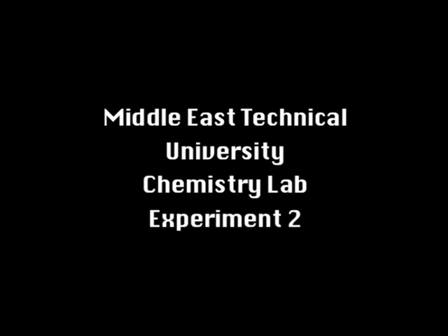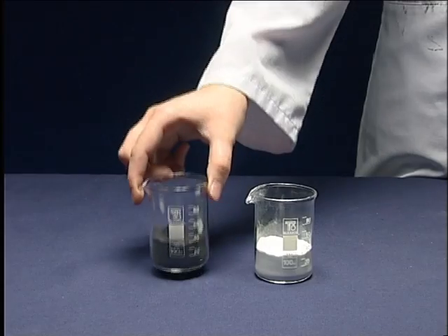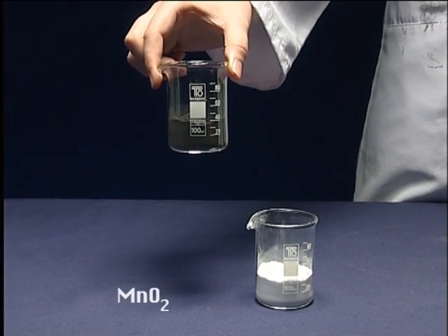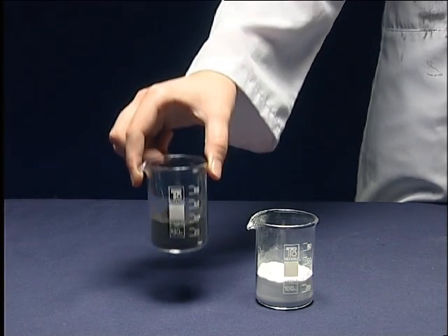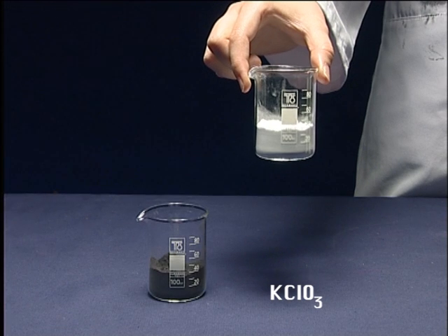Experiment 2: The Law of Definite Proportions. Percent Oxygen in Potassium Chlorate. Chemicals and Apparatus: Manganese Dioxide and Potassium Chlorate.